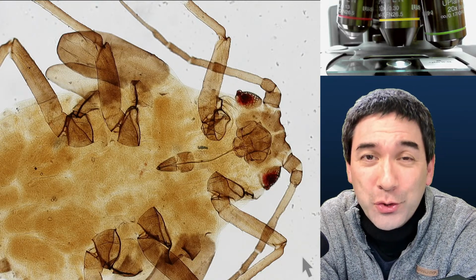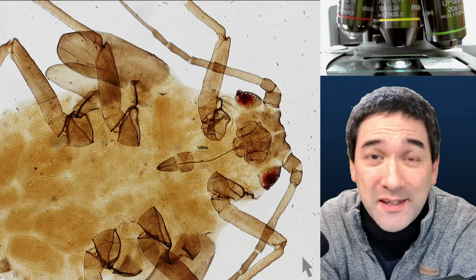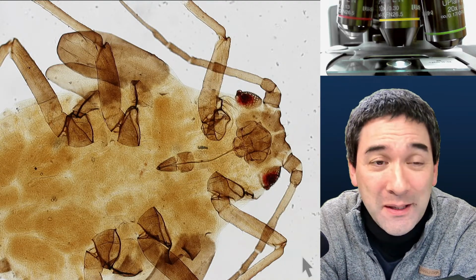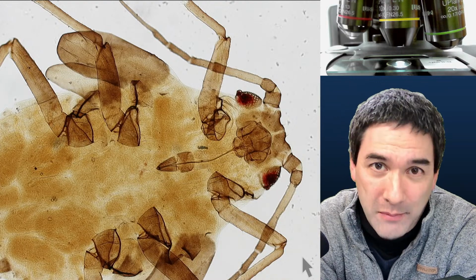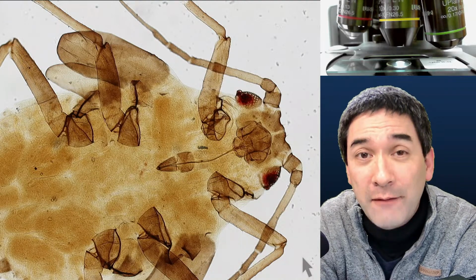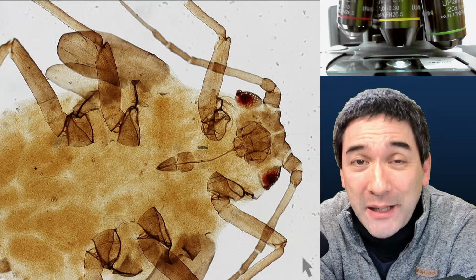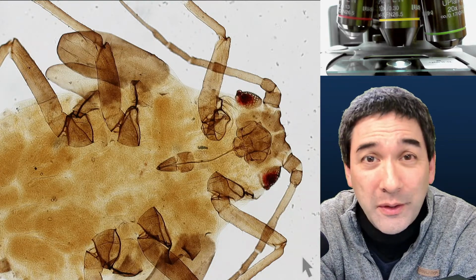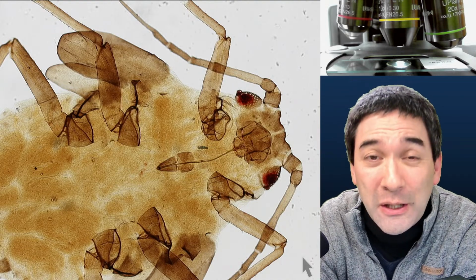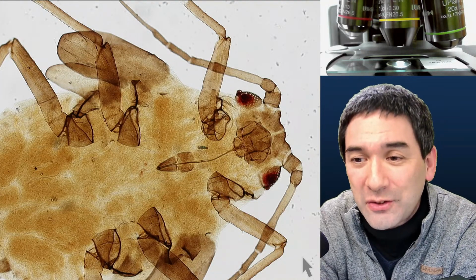Today I would like to show you a couple of prepared microscope slides about insects, and the one guy that you already see over here on my side, that's an aphid. Several slides I made myself, other slides are commercially prepared, and most of the slides I have not looked at myself yet. So it's going to be new for me too, because some time ago I bought myself a slide box with ready-made slides. A few weeks ago we already looked at a few of those slides together, but we did not look at the insects yet, so I would like to do that today.